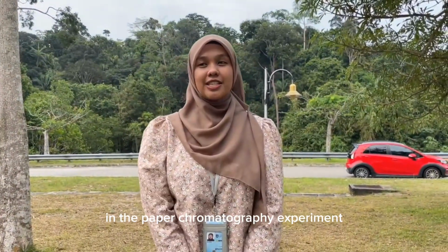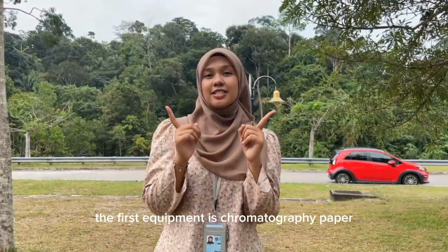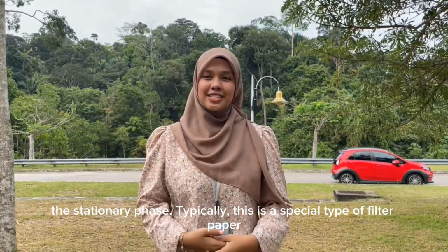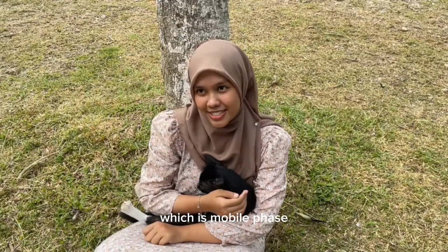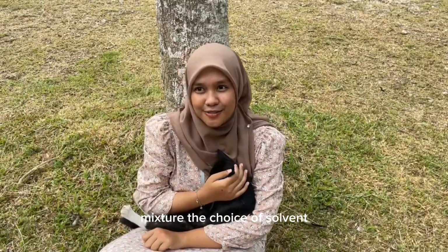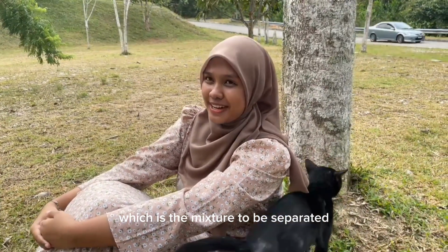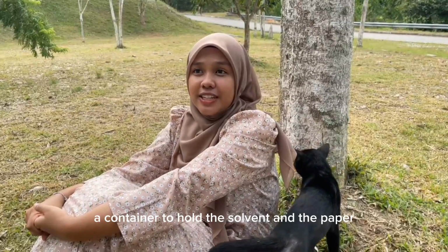In the paper chromatography experiment, we use some materials and equipment. The first equipment is chromatography paper, which acts as the stationary phase. Typically, this is a special type of filter paper. The second equipment is solvent, which is the mobile phase. A solvent is a liquid that dissolves the components of the mixture. The choice of solvent depends on the nature of the substances being separated. The third one is the sample, which is the mixture to be separated. And the fourth one is the chromatography chamber, a container to hold the solvent and the paper.